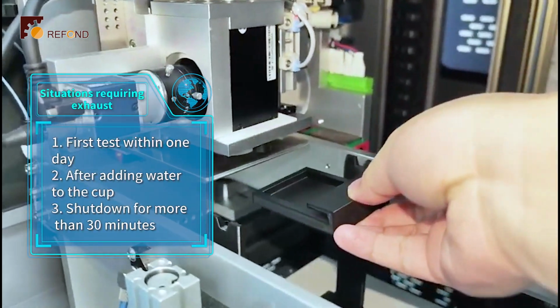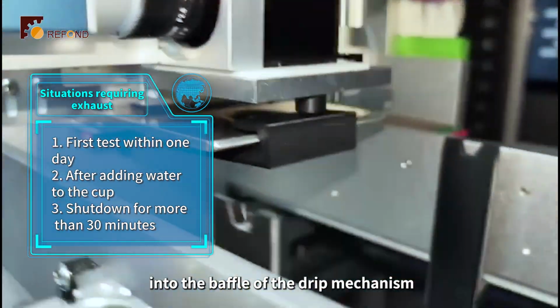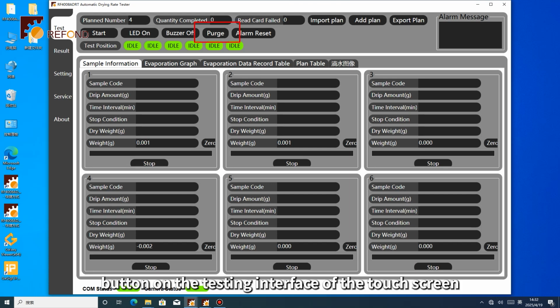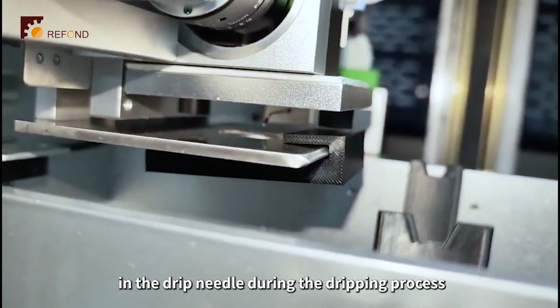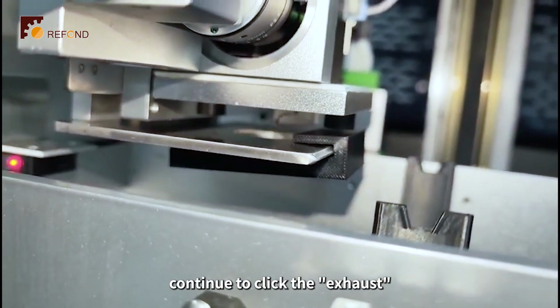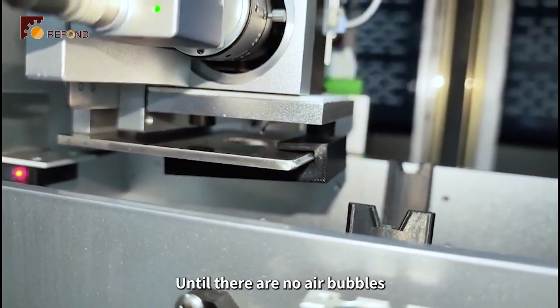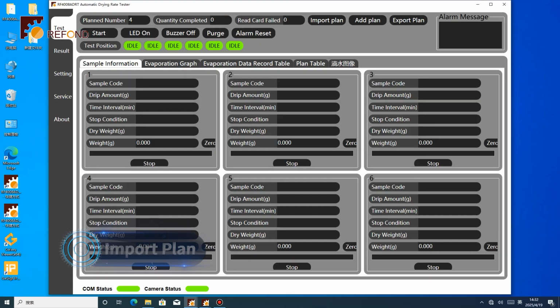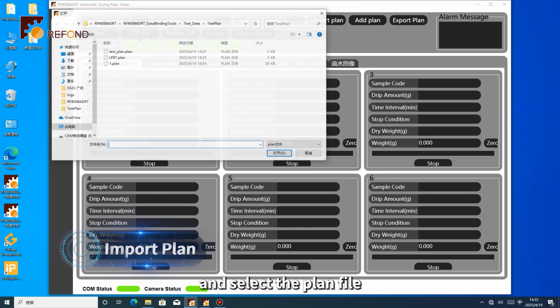Pipeline exhaust. Insert the auxiliary tray for exhaust into the baffle of the drip mechanism. Select the exhaust button on the testing interface of the touch screen. Observe whether there are air bubbles in the drip needle during the dripping process. If there are air bubbles, continue to click that exhaust button multiple times to exhaust until there are no air bubbles.